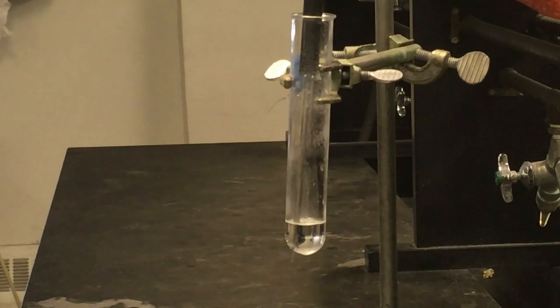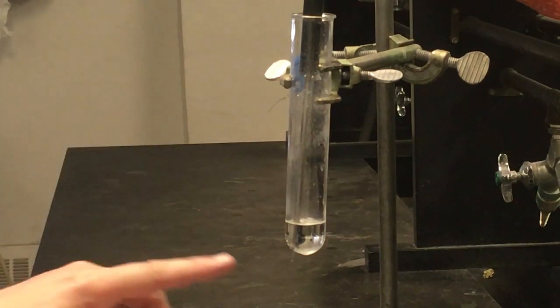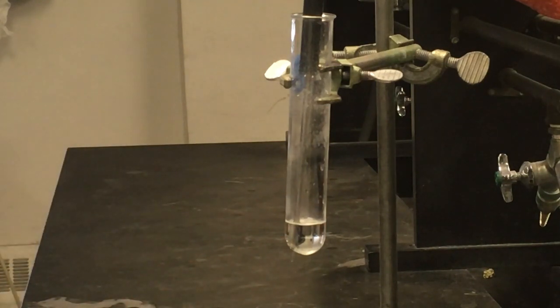We'll make note of when crystals are forming, either at the top or the bottom where we usually start to see them. Ideally, we'd like to see little glints of light being reflected by the crystals forming in the solution itself. Sometimes that's easier to see than others. In this camera view, it's not very easy to see, so it's easier for me to point out the top and bottom crystals as they start to form. Like I said, I'm just going to let this run. And once we get done with this particular trial, I'll go over the data like I did in the previous ones.